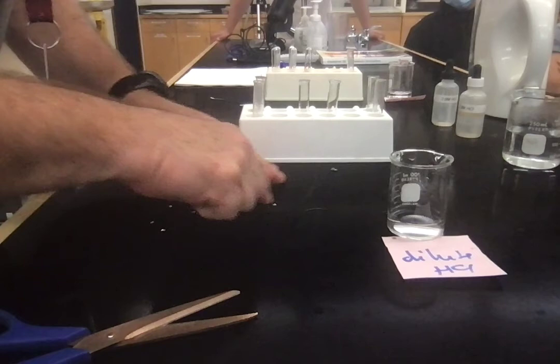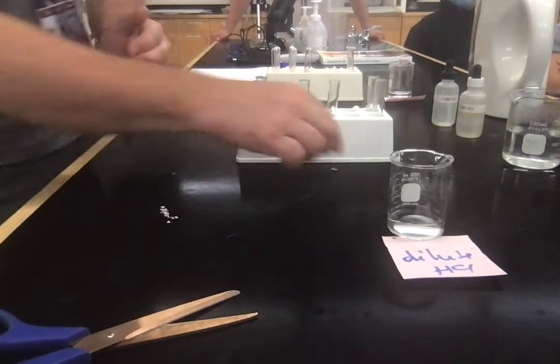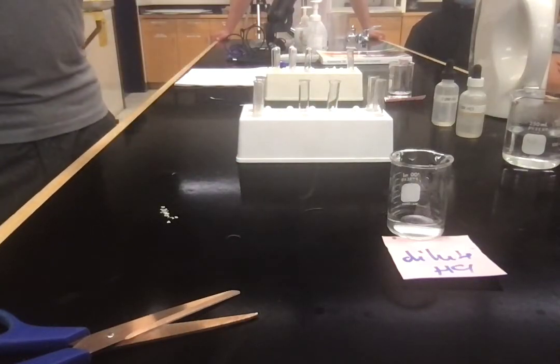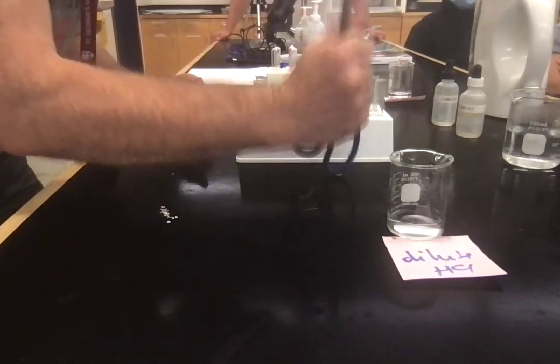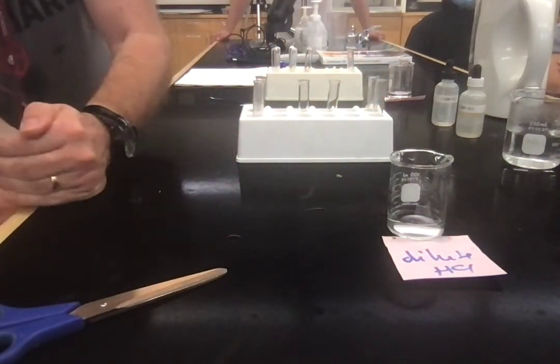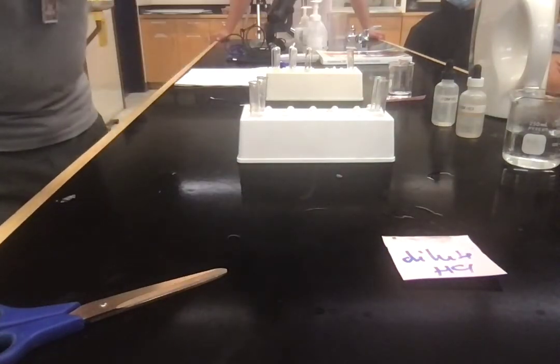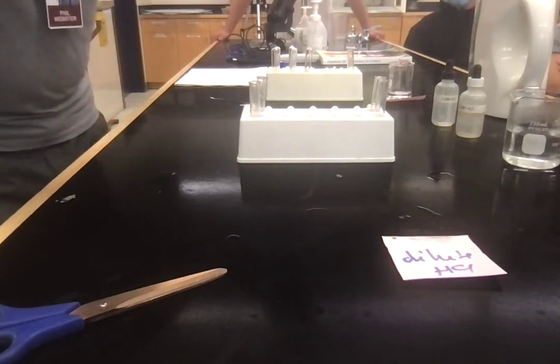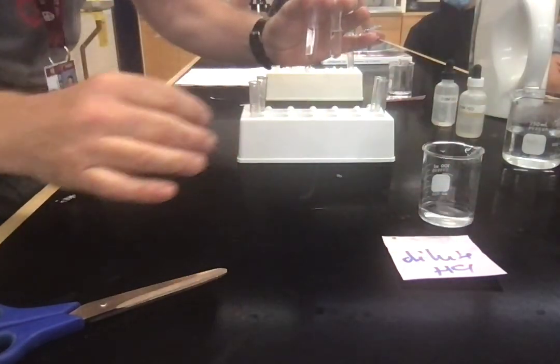Ah, yes. So, Angus, what are we changing? We're changing the surface area. The surface area. So this one is squashed, and if I could, I'd get that again, but I don't think I can because that's pretty squashed. Let's just squash it, shall we? Right, that's definitely squashed. And then on this side, come on. Okay. Close enough.